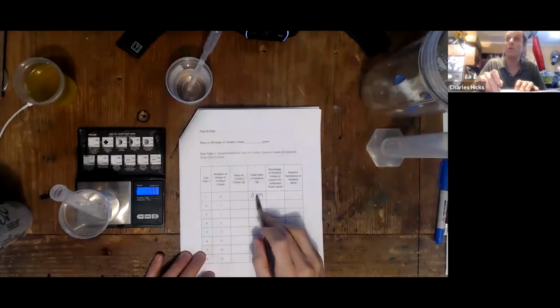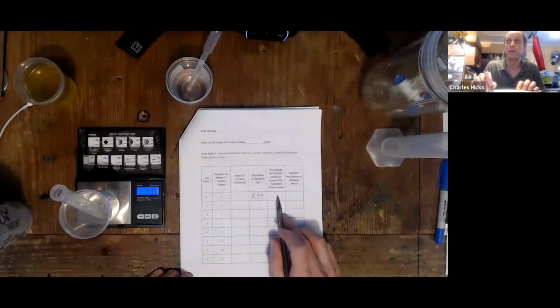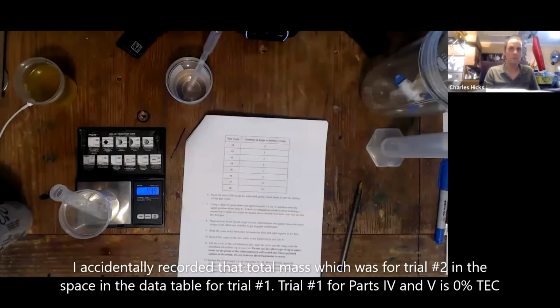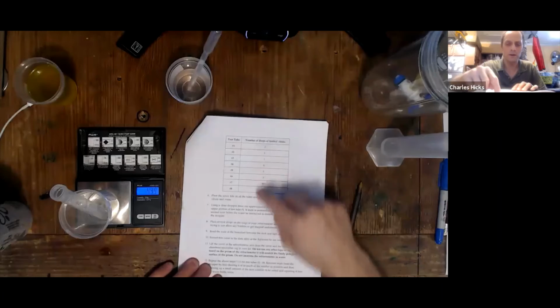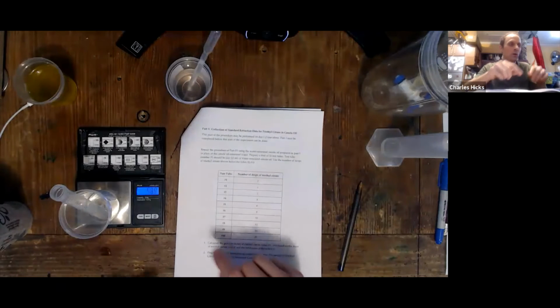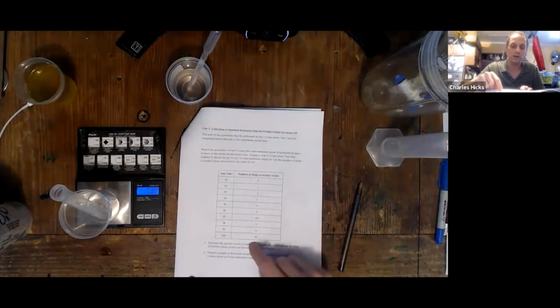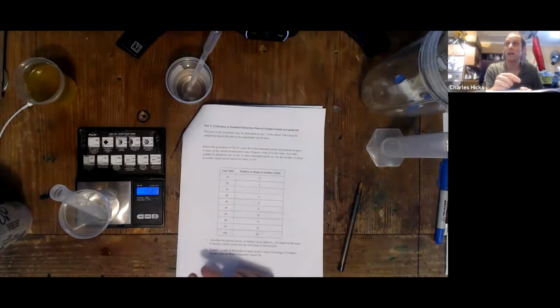Okay. That is the total mass of the solution that's in there, and with our calculation of the mass of the drop, we'll be able to calculate the mass by percent of the triethyl citrate, or in my case, acetone, that's in that solution. So prepare a total of 8 of those solutions that are water-based, and then you'll follow the same basic procedure, creating oil-based solutions, switching to adding this as the solvent, adding this number of drops of the triethyl citrate, and recording the total mass after you've adjusted to be about 5 grams.